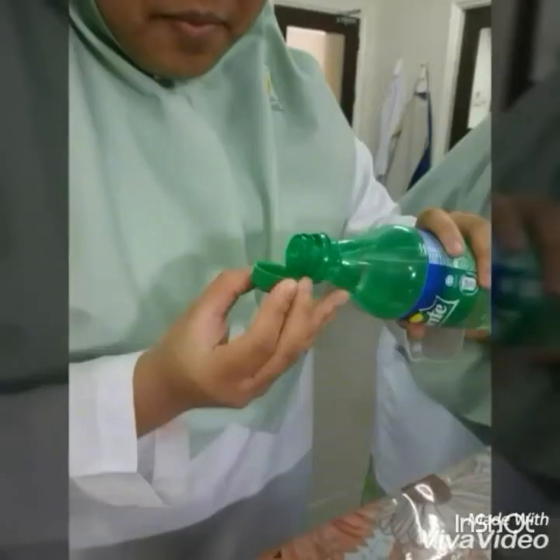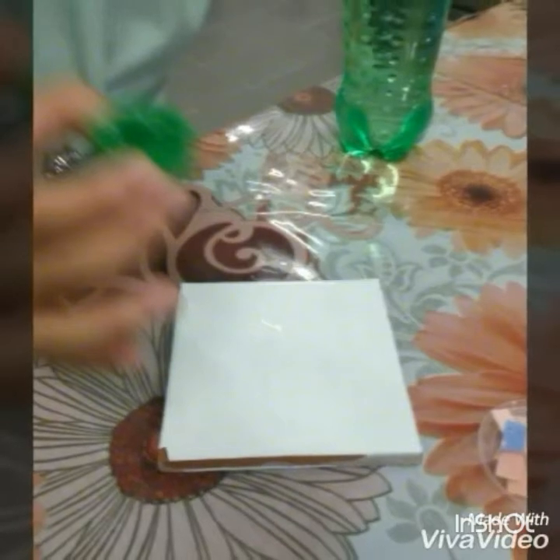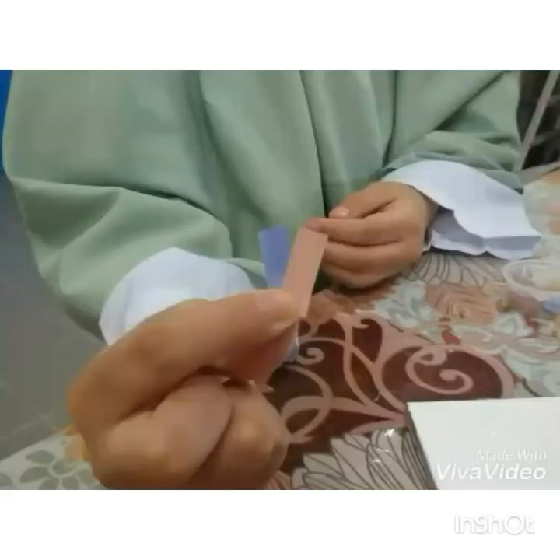With Sprite, we poured some into the cap, then onto the white tile. After that, we dipped the blue litmus paper and then the red litmus paper. The results came out to be acidic.